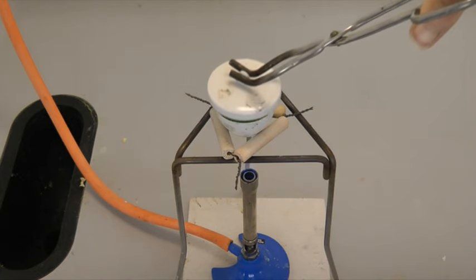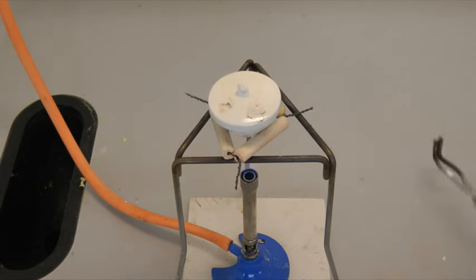The open crucible should always be viewed from the side and never from directly above even though you're wearing safety glasses.